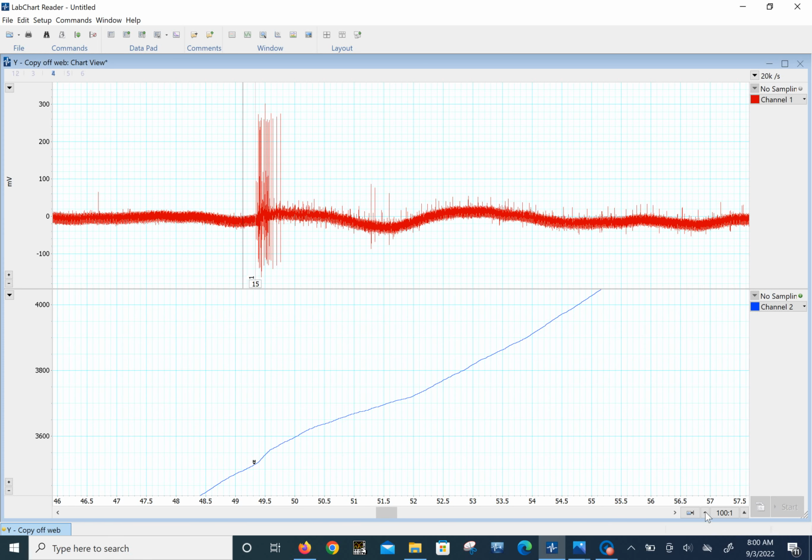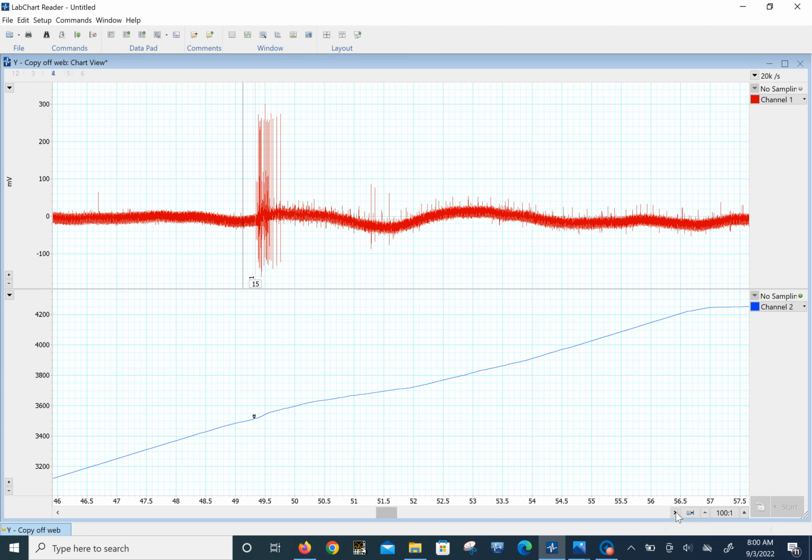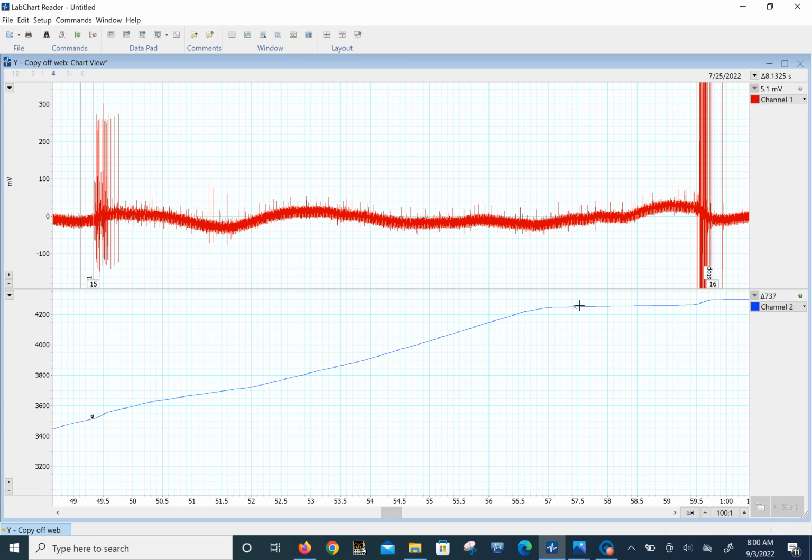Well, we can crunch this up a little bit so we get 10 seconds. Let's do that. Auto scale. And let's find out where 10 seconds would stop. About there. And now we get 750. But when you look at it, it really isn't a larger number of these kind of spikes that are outside the noise compared to what we had in saline. And we still get a few of these, right? Maybe about 27, even if you go in and hand count them.